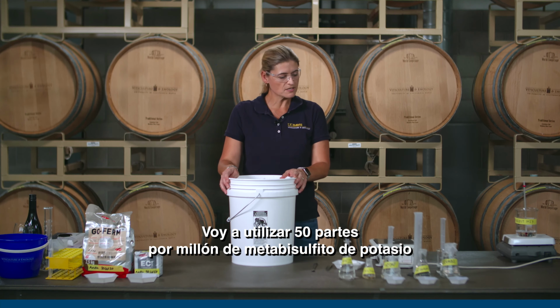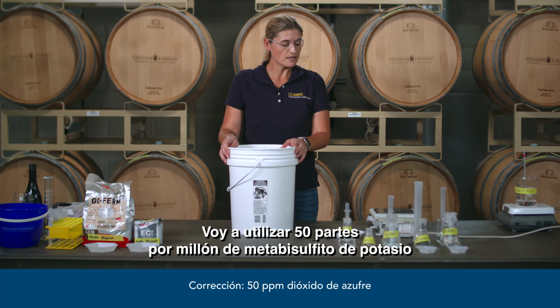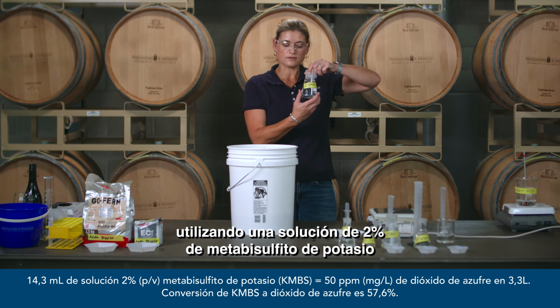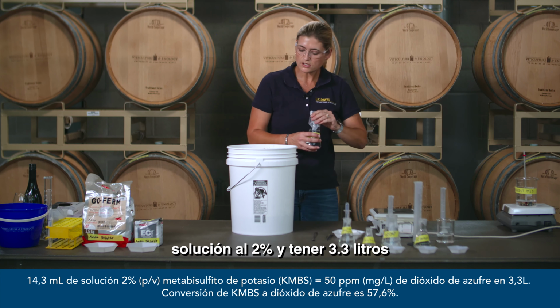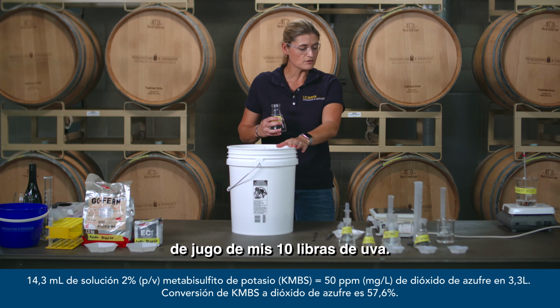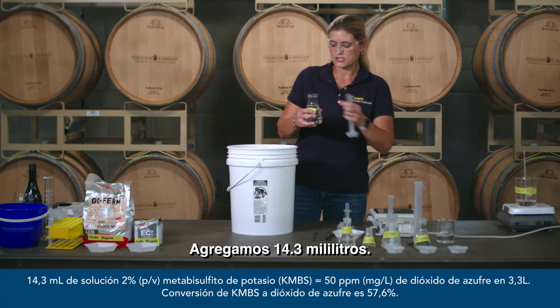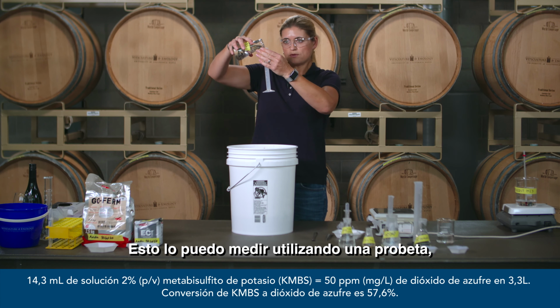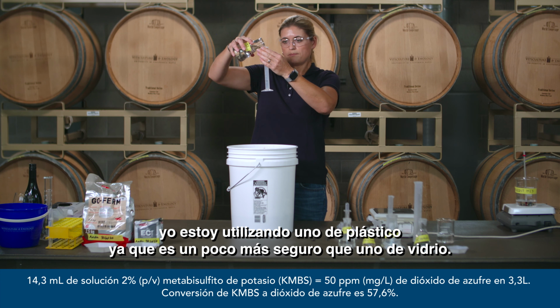I'm going to add 50 parts per million of potassium metabisulfite by using a 2% potassium metabisulfite solution. 2% solution, and I have 3.3 liters of juice coming from my 10 pounds of grapes. That will be an addition of 14.3 milliliters. I'm measuring this using a measuring cylinder. A plastic measuring cylinder is a little bit safer than glass.